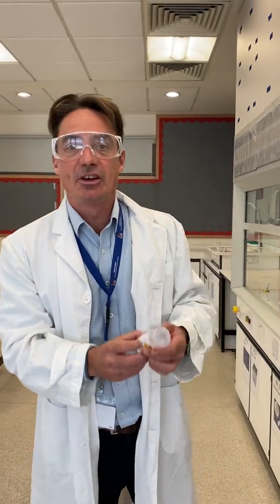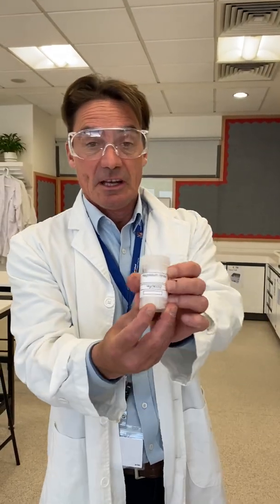Hi Year 11, I haven't done the thermal decomposition of group 2 nitrates yet, so I wanted to show you those.